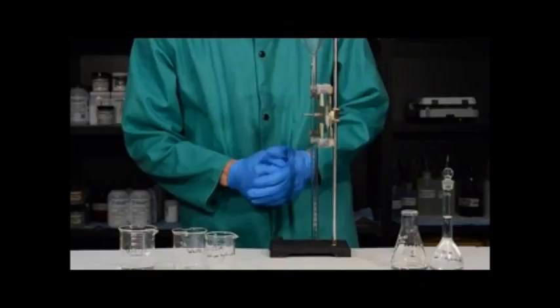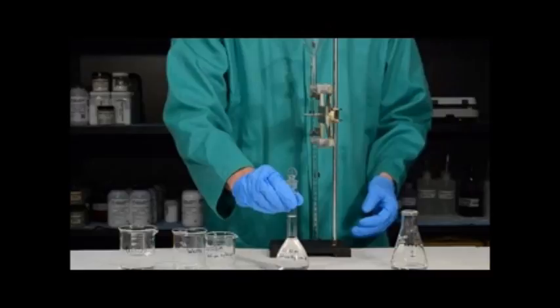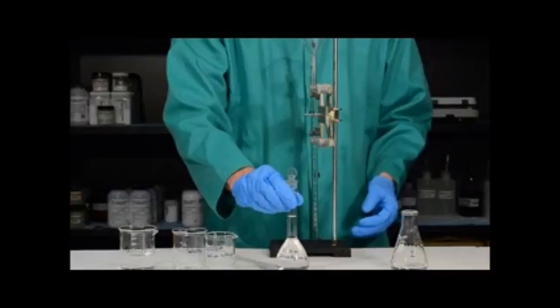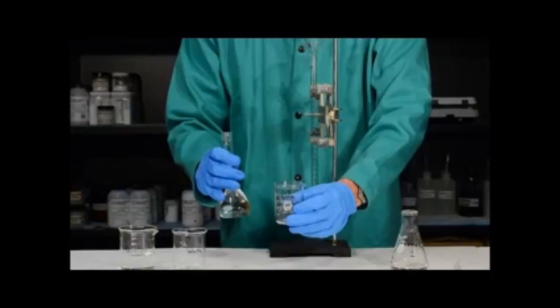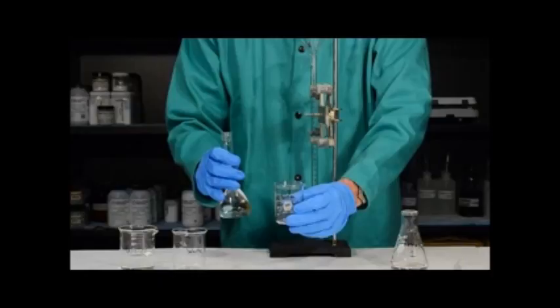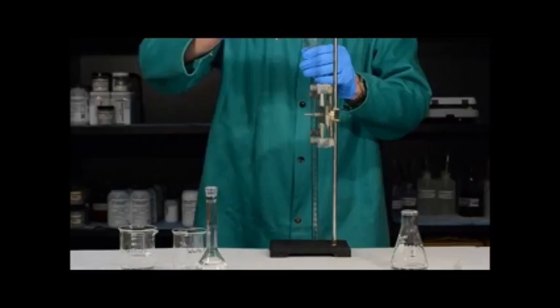Now that I've rinsed the burette three times with water, I want to rinse it with some of my sodium hydroxide solution. Right now the burette is wet and that water will dilute the sodium hydroxide solution. To avoid that, rinse the burette with three portions of sodium hydroxide — one to two milliliters each is plenty. It is bad practice to pour directly from the volumetric flask into the burette. Instead, get a clean, labeled, and dry beaker, add some sodium hydroxide into it, and use that to rinse the burette with three two-to-three milliliter portions.